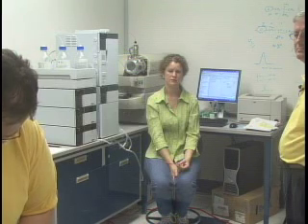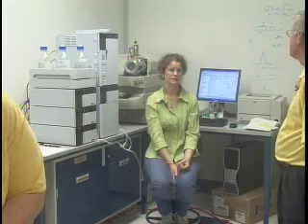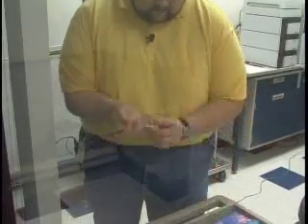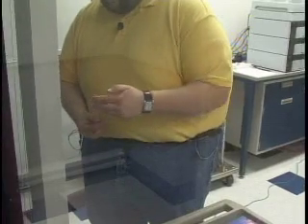And hopefully it won't be too dilute. It works without putting a syringe needle on it too. I never put one on. That's because you're a rebel, Bill.